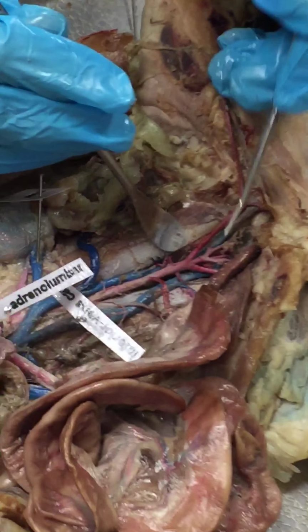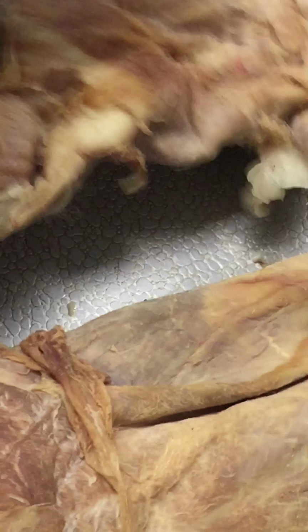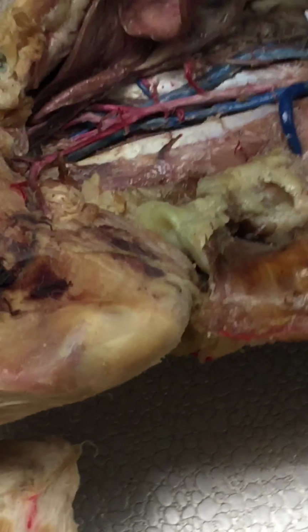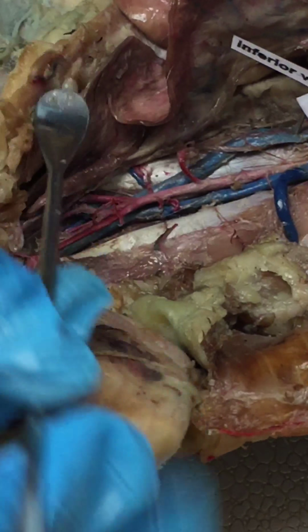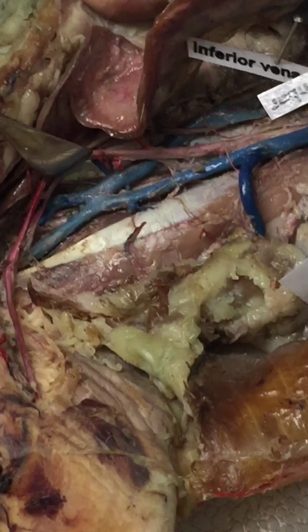So, let me swing this around for you guys. If you can't see it, I will swing it back around this way and show you after we're done. Leo, same for you. If you can't see it, I'll make sure you see it after this. So don't look at the red. Those are arteries. We'll be looking at the blue.